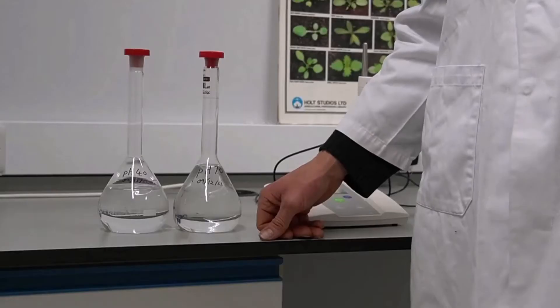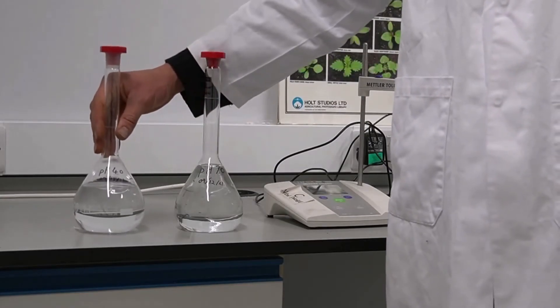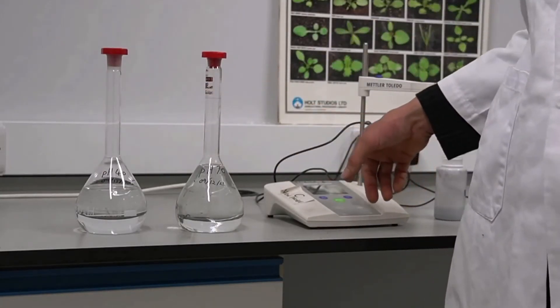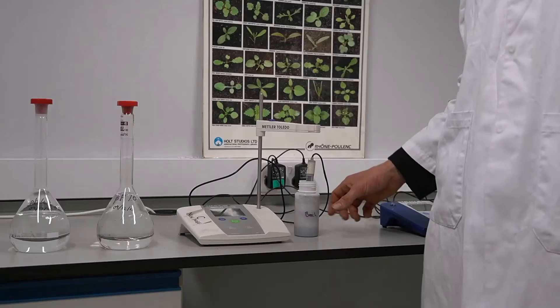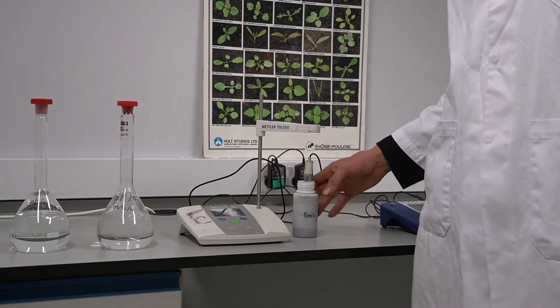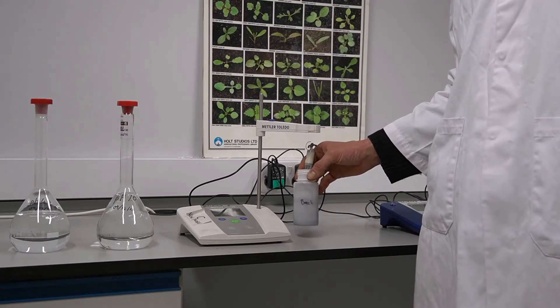I've set up here some simple analysis of a couple of soils I've collected for my research. One is from a beech forest in Germany that used to be an old glacier, and the other is from a field near my university. Before I measure the pH of the soil I have to do what's called a calibration of my pH probe. I have two solutions — one accurate to pH 4 and the other accurate to pH 7 — and I tell my pH probe what those values are so it can create a curve to measure other pHs along that line. This soil from the beech forest in Germany is very acidic at pH 4, because it's so sandy and has a high organic matter content, which lowers the pH considerably.